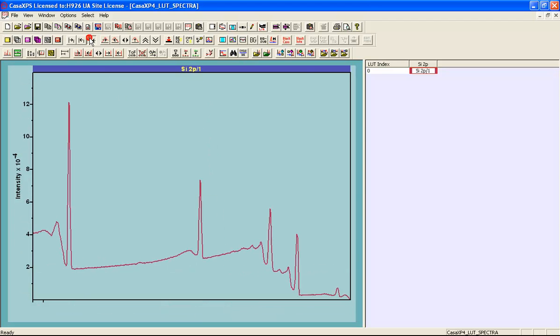So that's the first clue that we should investigate this sample in more detail. This survey spectrum is constructed from a set of images, and these images are processed and provide signal at each pixel so that we have spatial spectra. That is to say, at each pixel there is a spectrum from which we can extract information about the oxygen, carbon, and the silicon peaks.